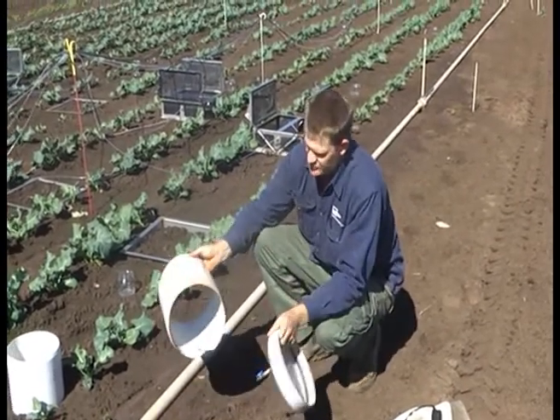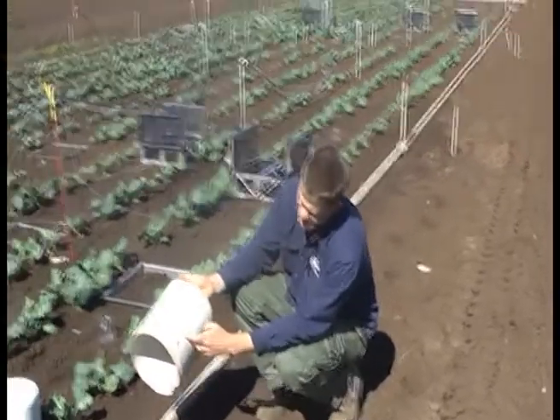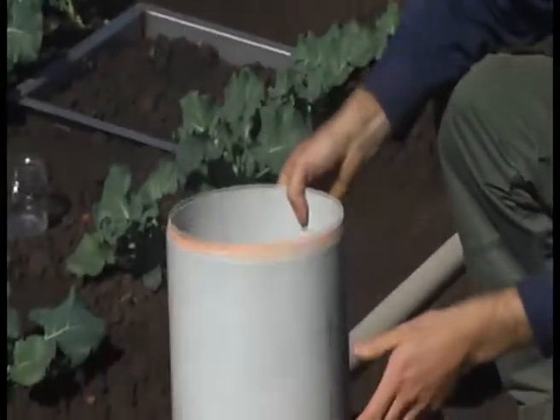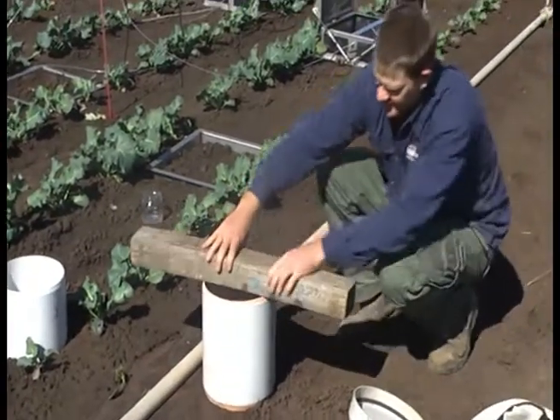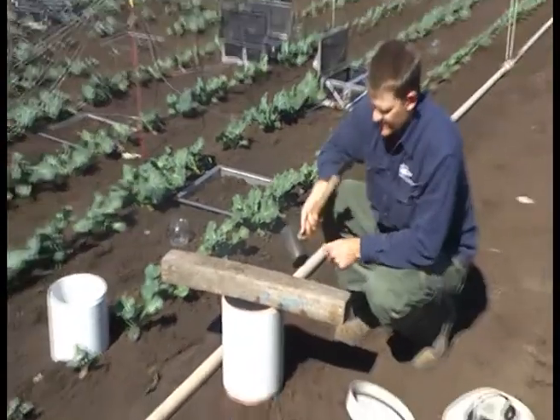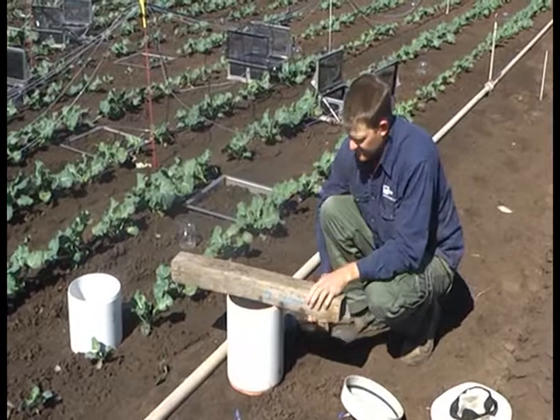It comprises of two parts. This is the chamber itself. We just etch a line into the chamber at 10 centimetres. That gives us 20 centimetres of headspace above the ground. Both ends are tapered — one end you whack into the soil. Of course it helps if it's quite wet or freshly tilled, but these chambers are quite robust and they can be hammered into quite heavy soil.